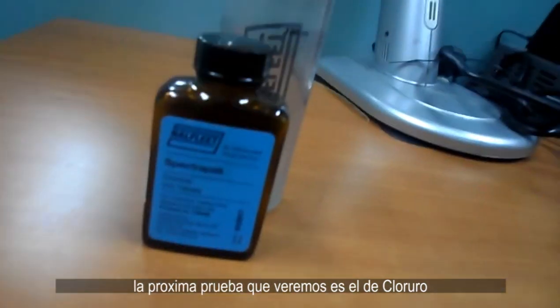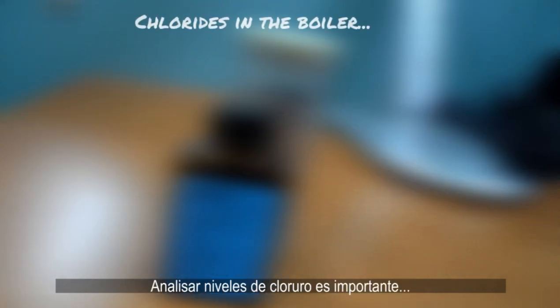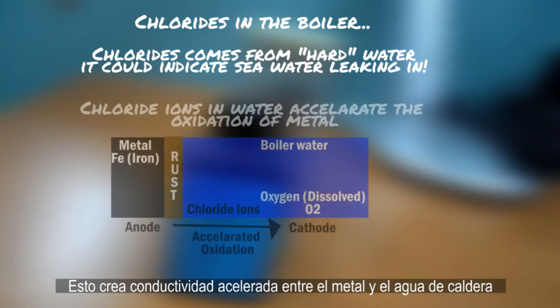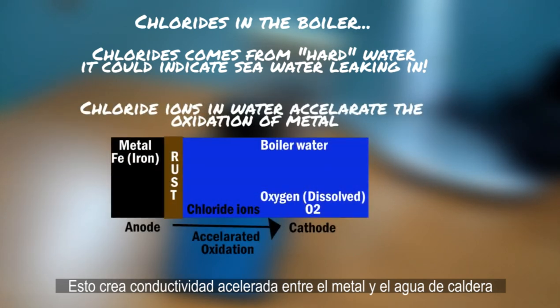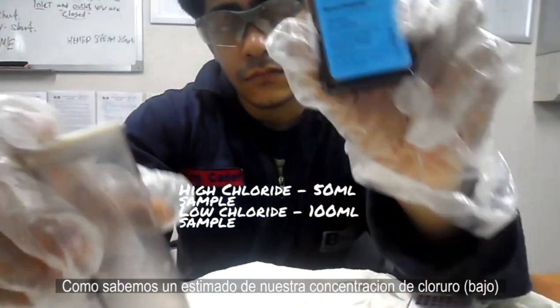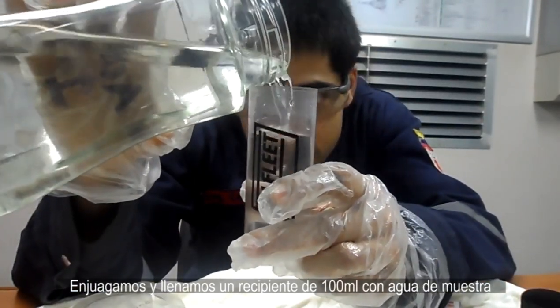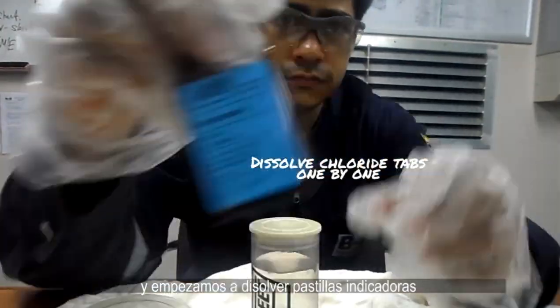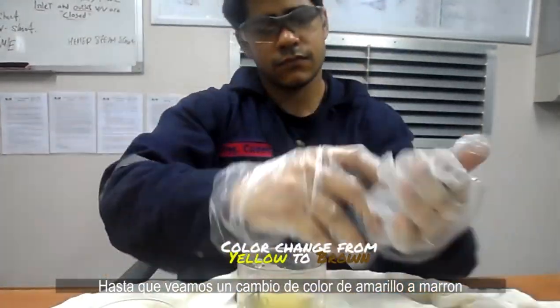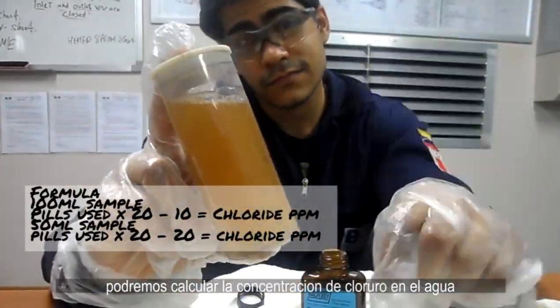The next test is the chloride test, using a beaker and testing pills. Testing for chlorides is very important as it indicates seawater contaminating the boiler water. This causes increased conductivity between the boiler metal and its water, accelerating oxidation. We rinse and fill a 100 milliliter sample and start dissolving indicator pills until we see a color change from yellow to brown. Depending on the number of pills used, we can calculate the chloride concentration.